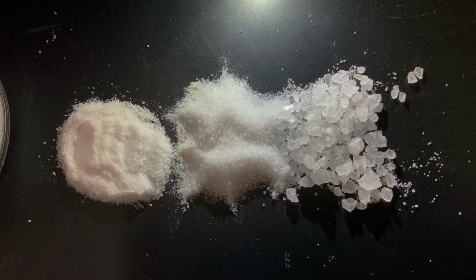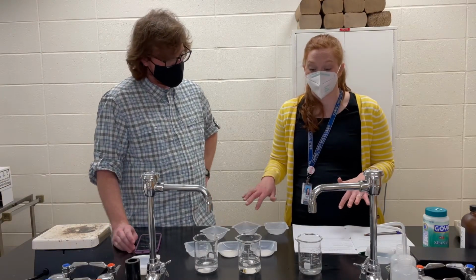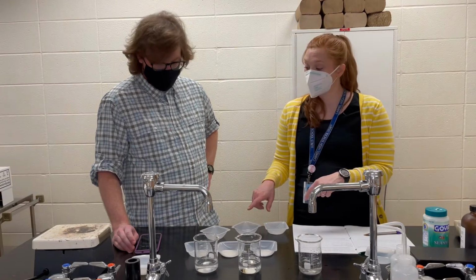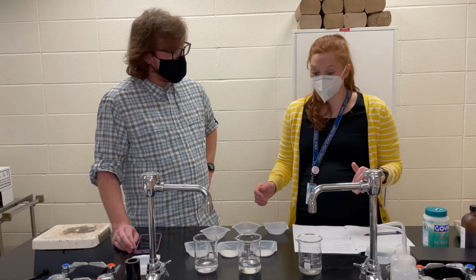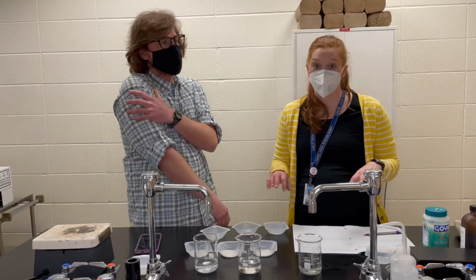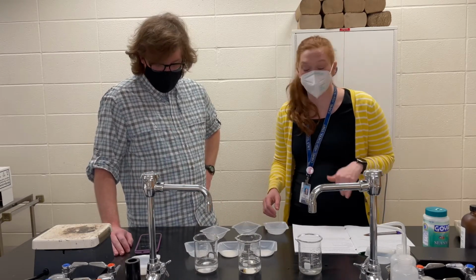These are all the same mass. So these are 0.25 grams of salt. The only difference this time for us is going to be the size of the crystals. We've got the same volume of water, same temperature of water, same mass of salt. Yep. So we're going to take a look at these. We're going to stir these this time around. I'm going to take over stirring duty since Mr. Sharkey did the heavy lifting on part one with all that stirring, especially me on that cold water one.